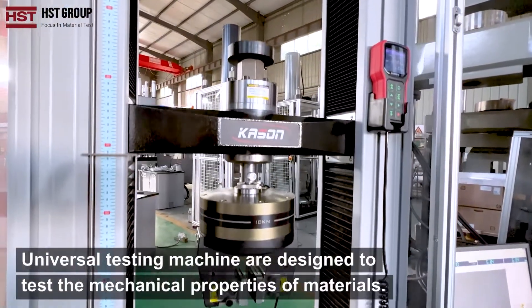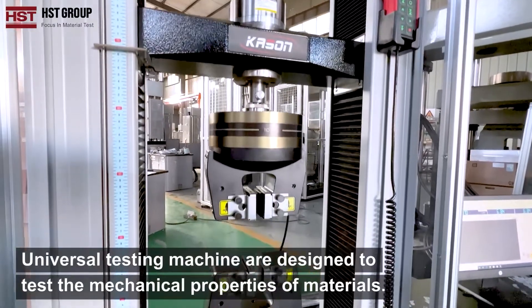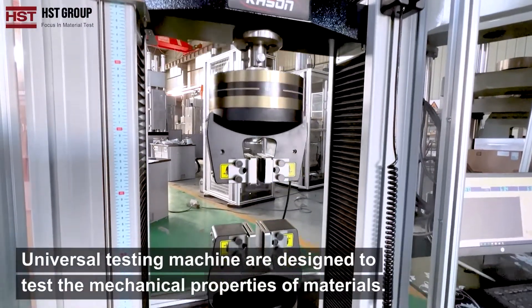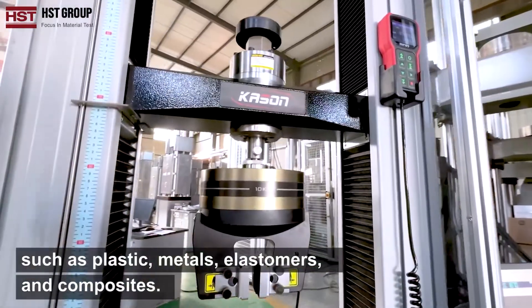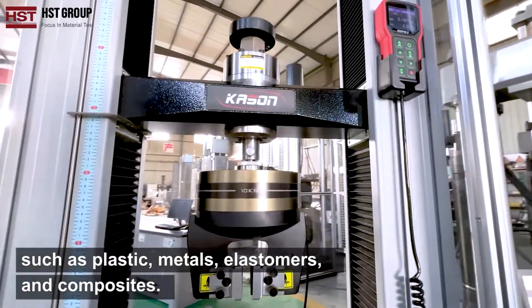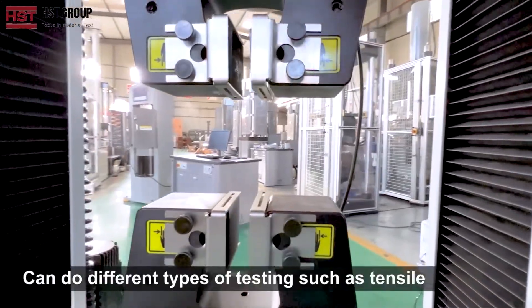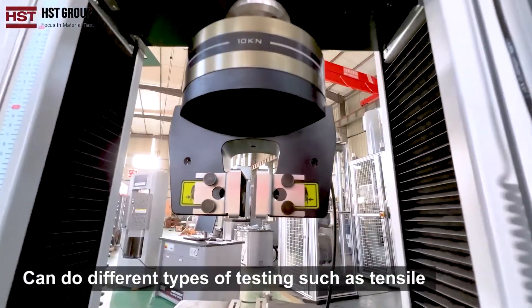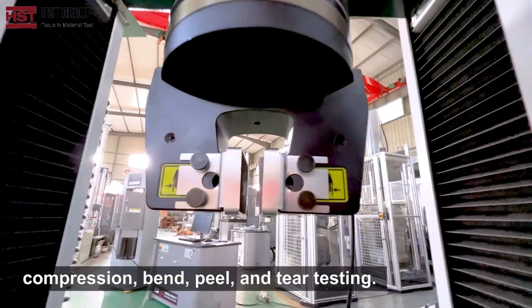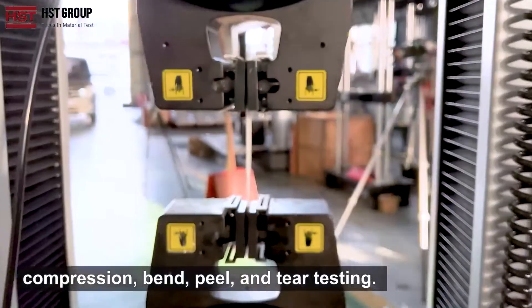Universal testing machines are designed to test the mechanical properties of materials such as plastic, metals, elastomers, and composites. They can do different types of testing such as tensile, compression, bend, peel, and tear testing.